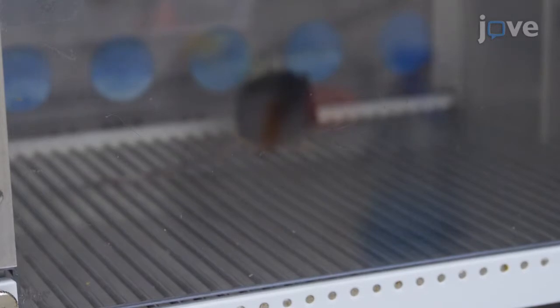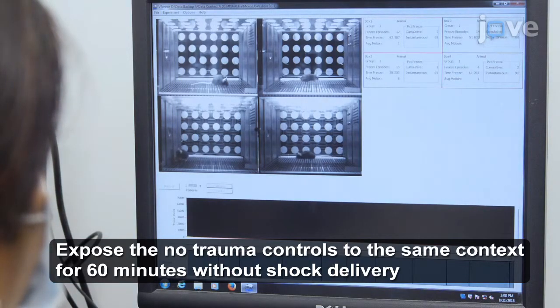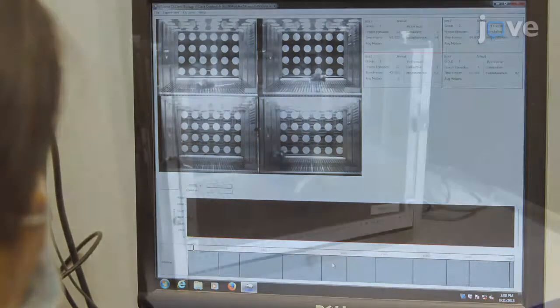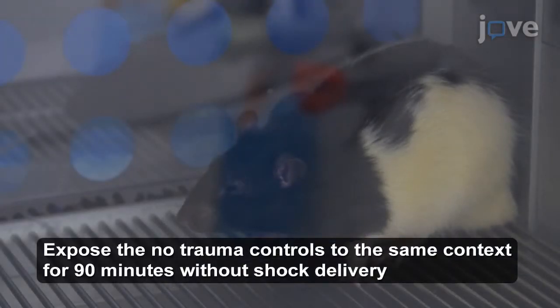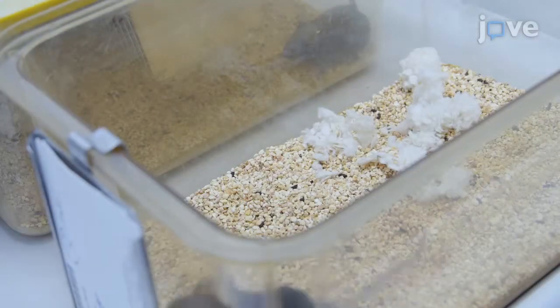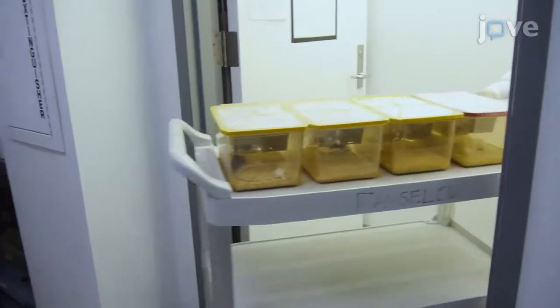For mouse experiments, use the shock generator and scramblers to deliver 10 1-second 1 mA foot shocks, randomly presented over 60 minutes through the grid floors of the chambers containing trauma-conditioned subjects. For rat experiments, use the shock generator and scramblers to deliver 15 1-second 1 mA foot shocks, randomly presented over 90 minutes through the grid bars of the chambers containing trauma-conditioned subjects. After 90 minutes for the rat or 60 minutes for the mouse experiments, return all animals to their home cages, and promptly return to the vivarium.